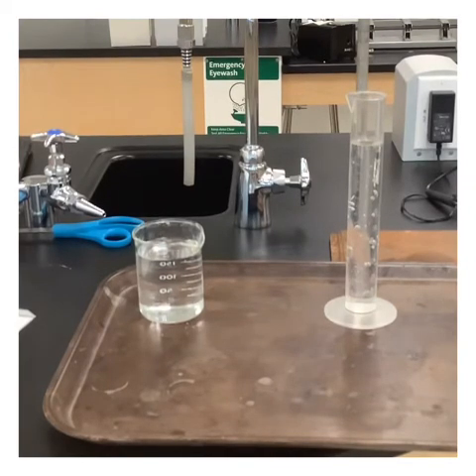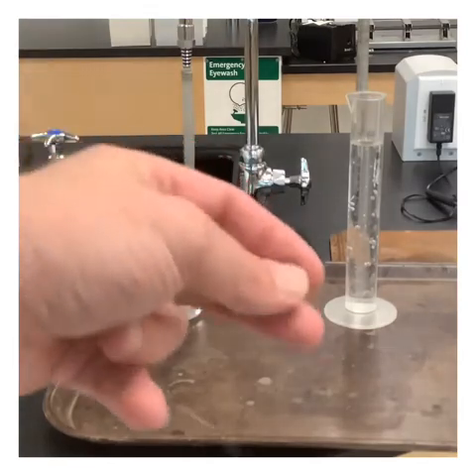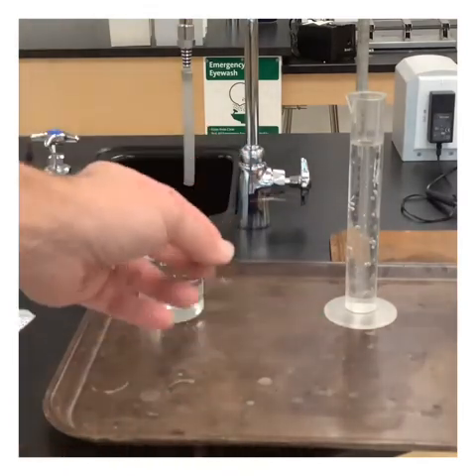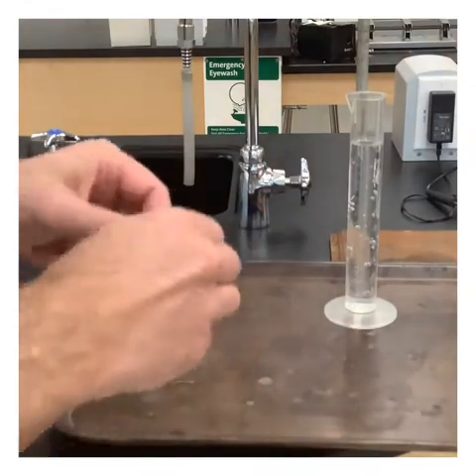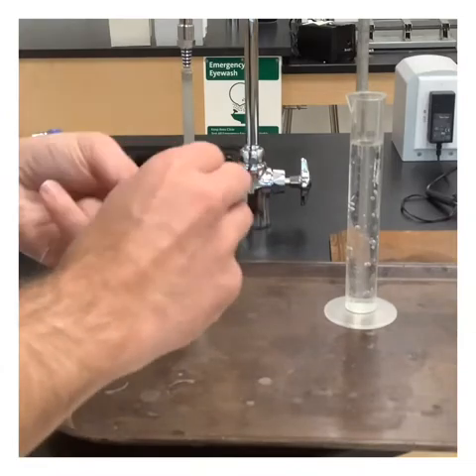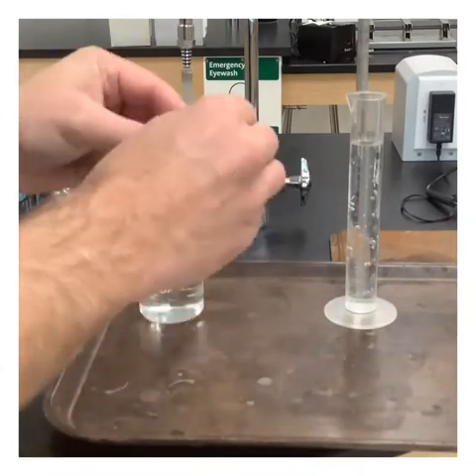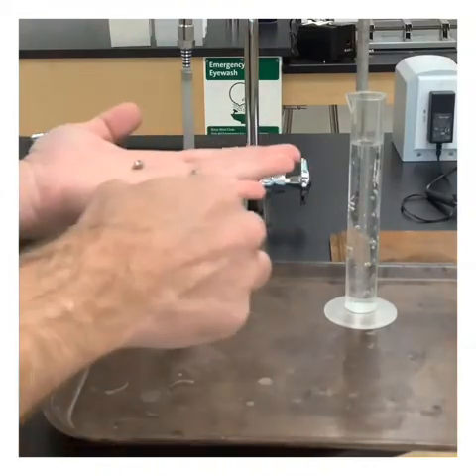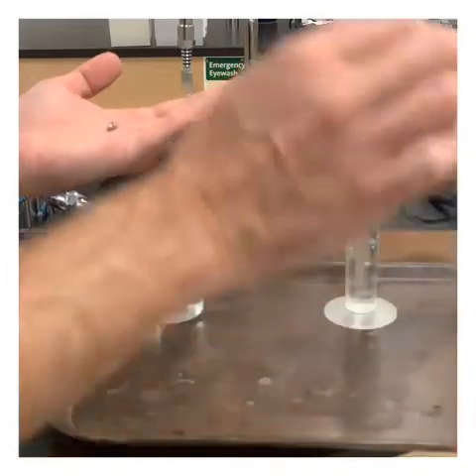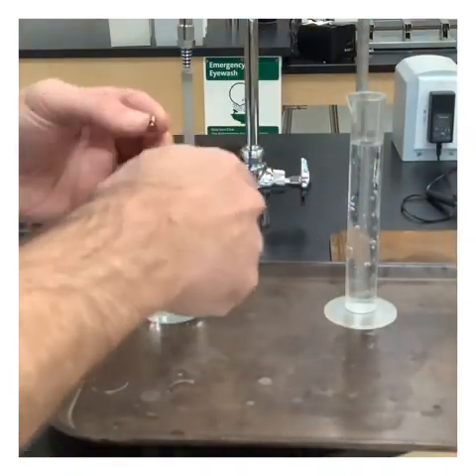All right, the next thing that we want to do is we want to build a little cage for our magnesium. We want to keep our magnesium safe and secure in a cage. So I have some very thin copper wire here. Some very, very thin copper wire. And what I'm going to do is I'm going to take this magnesium and I'm just going to kind of ball it up. All right, so we're going to make like a little ball of magnesium here. So we see this ball of magnesium. And I'm going to start wrapping it up in this really thin copper wire. I'm going to make like a little cage out of the copper wire.